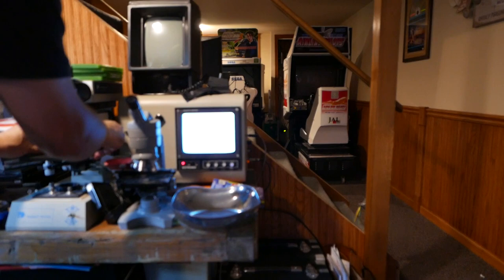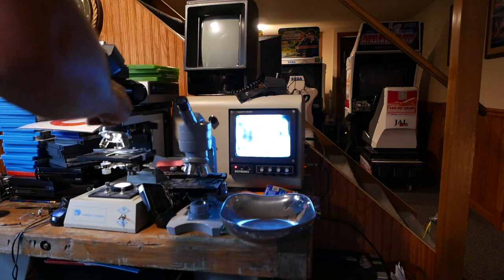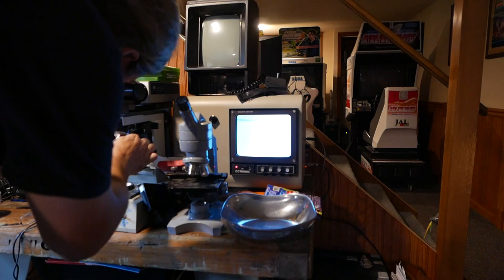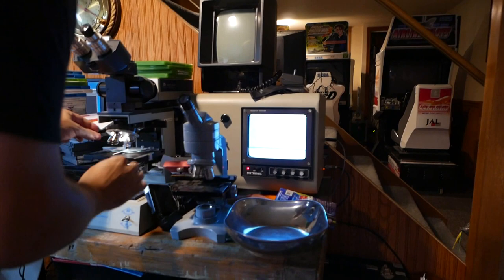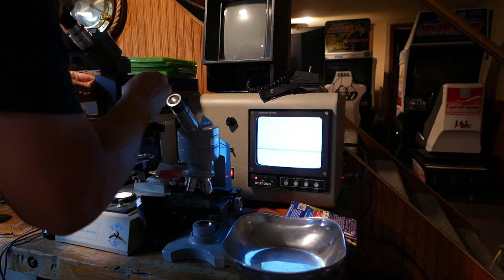I'm setting it. I'm trying to set it the correct way. Okay, now it's good. You have the witty cut right there so you can see what's happening. The camera needs to be closer — I can barely see it. We don't have anything yet. Setting camera closer. It looks like blobs. I can barely see it. All I see is blackness on this.